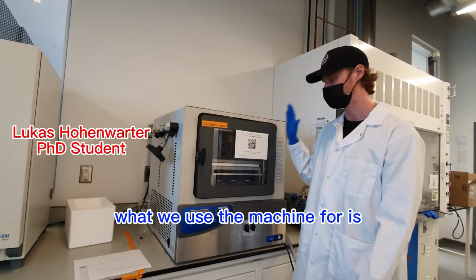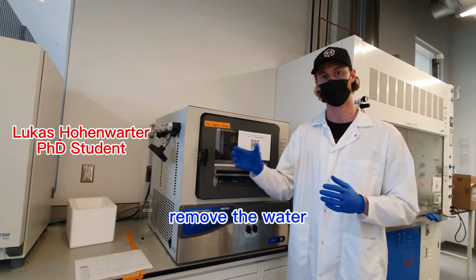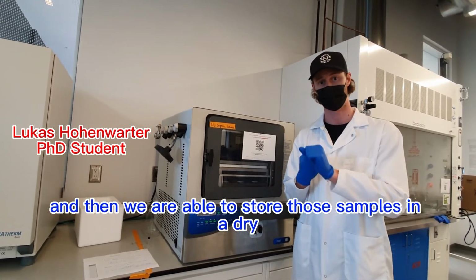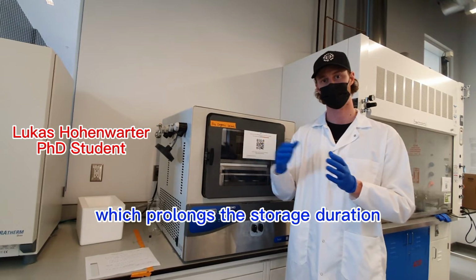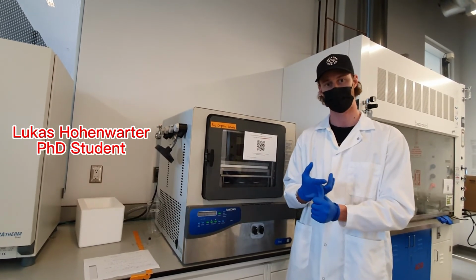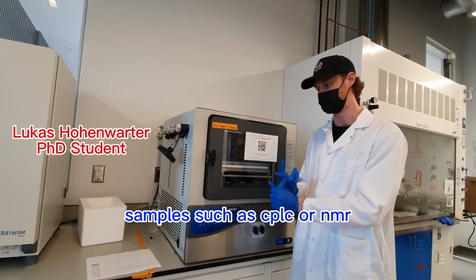What we use the machine for is primarily biological and chemical samples. We remove the water, and then we are able to store those samples in a dry phase or in a solid state, usually a powder, which prolongs the storage duration, and also a lot of times that is used to do analyses with these samples, such as UPLC or NMR.